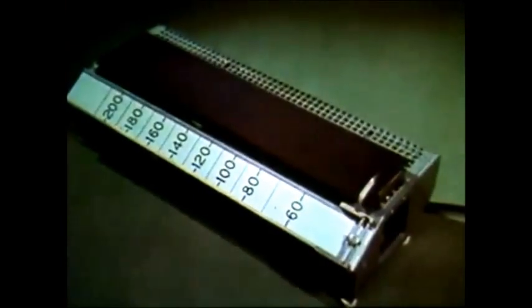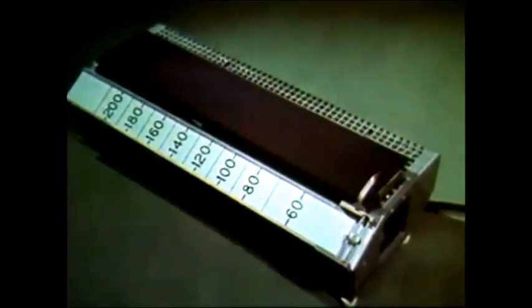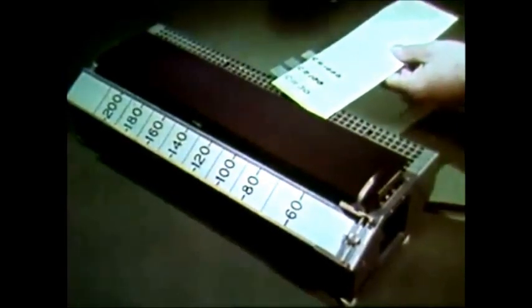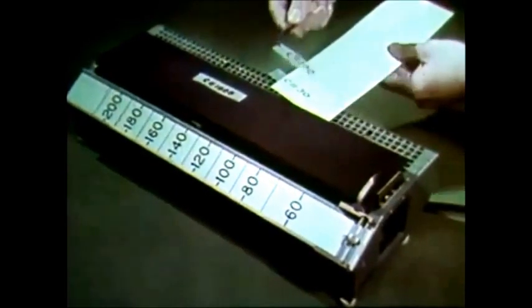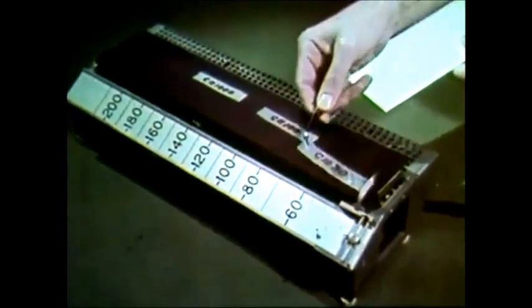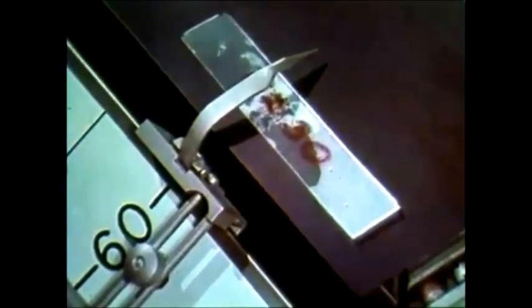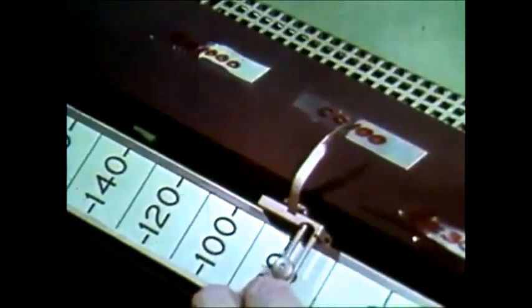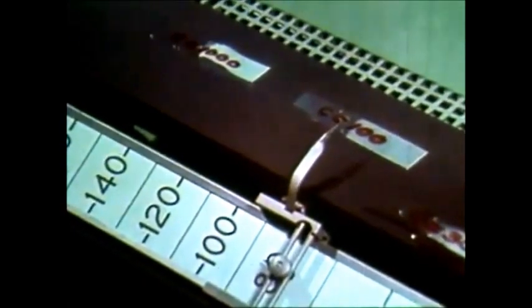Melting points can be determined on a special hot plate whose temperature rises along its length. The samples to be melted are all hydrocarbons, ranging in size from about 1,000 carbon atoms to 30. As they melt, they become clear. Wax melts at about 60 degrees centigrade. The cohesive forces between small wax molecules are relatively weak. This sample melts at about 80 degrees centigrade because the cohesive forces between these larger molecules are greater than those in wax.